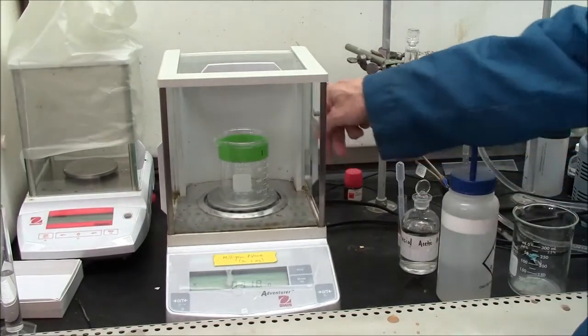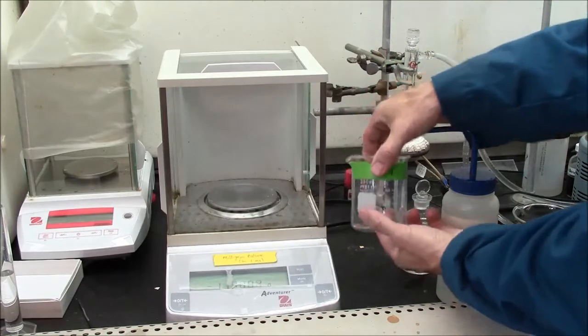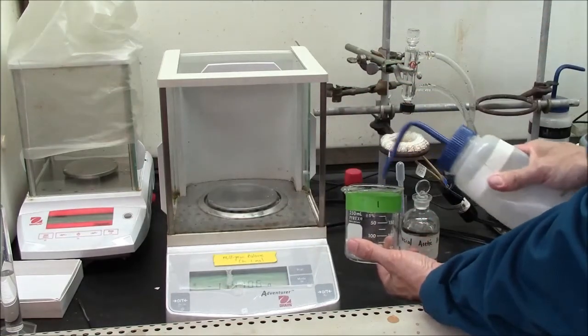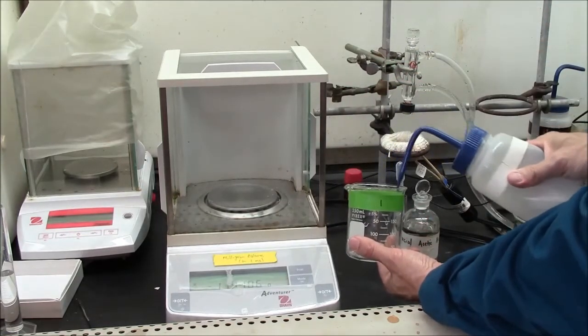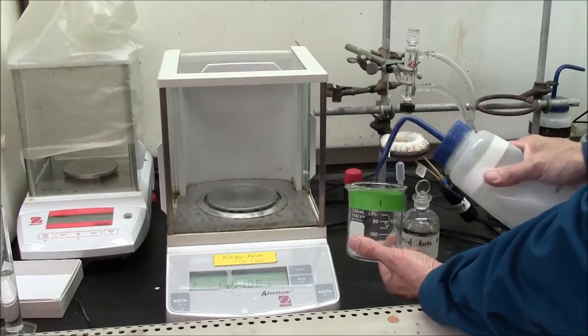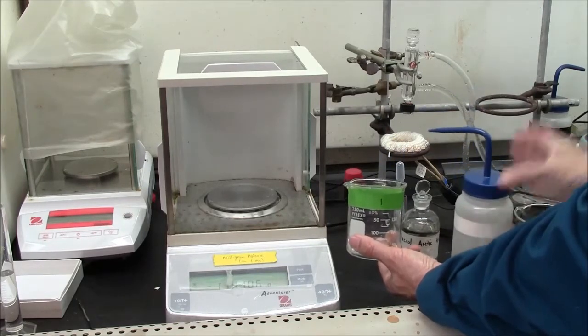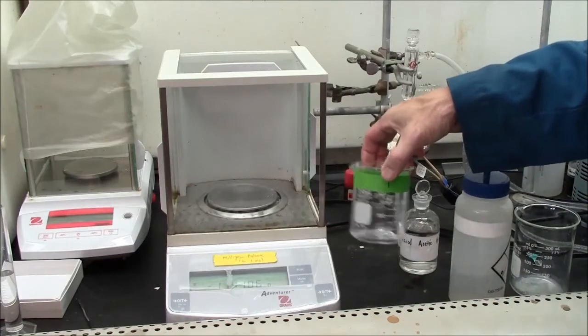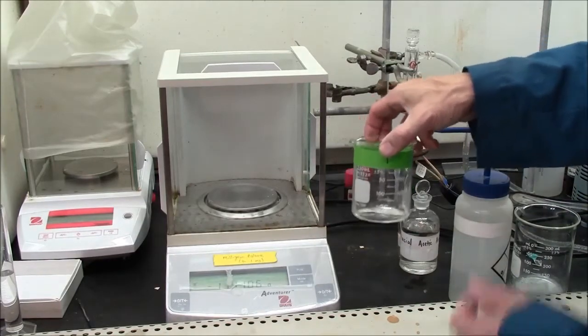I recommend that you add water to your concentrated acetic acid prior to removing it from the hood. The concentrated acid has a very powerful odor. You'll recognize it. It's the smell of vinegar, but it's very powerful unless you dilute it, as I've done here.